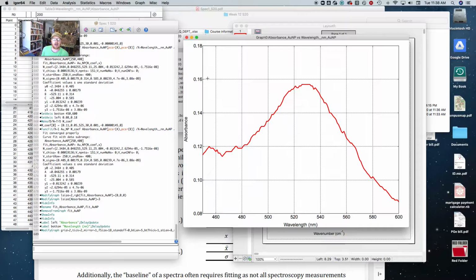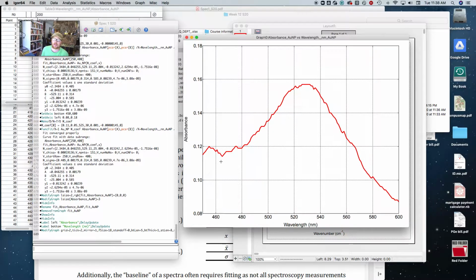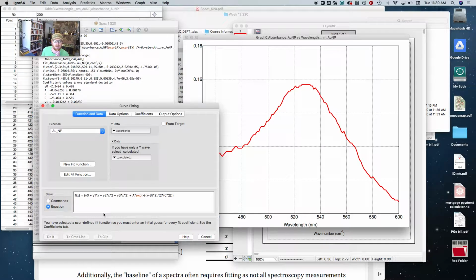away. And to show you that, first of all, what I did was I plotted this over a range where the spectra fits really nice. I did from 450 to 600 nanometers and 0.08 to 0.18 absorbance units. That centers the spectrum really nice on the graph. And if I go to do this initial curve fitting, this is the equation I came up with.